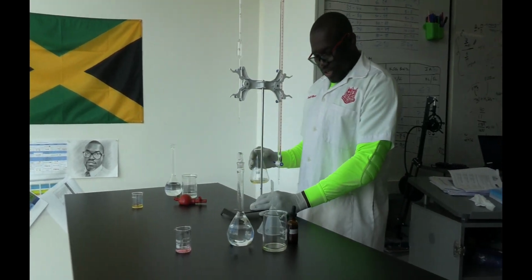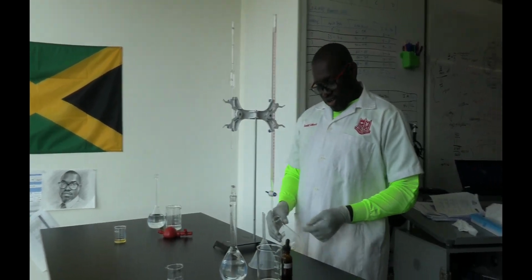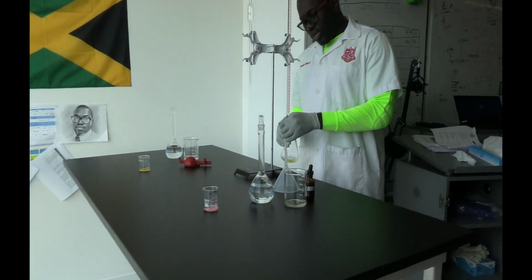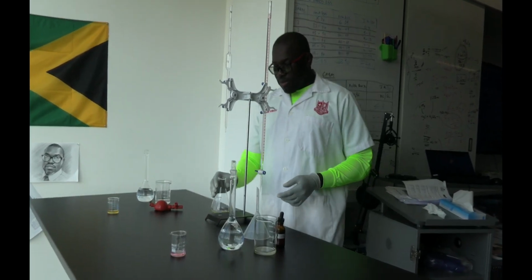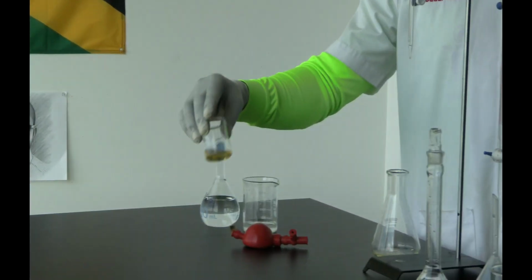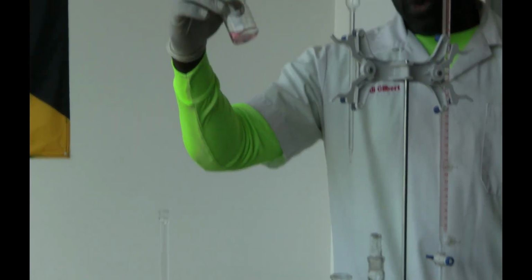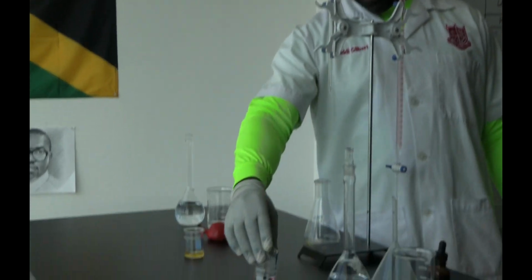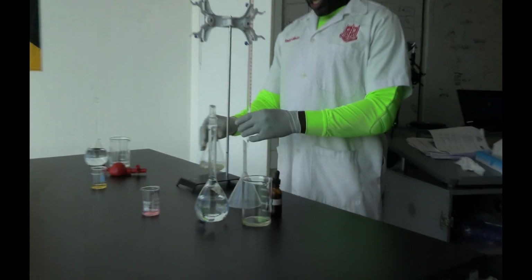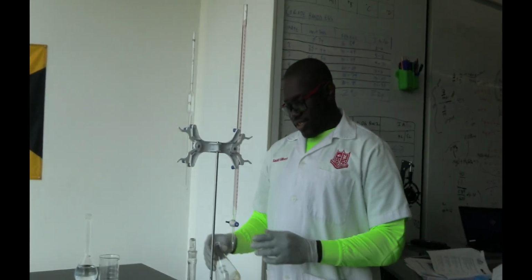And titrate means that I'll be adding a solution from a burette to a solution in a conical flask until I get to an endpoint in this context. And an endpoint is when I get a color change. And remember, we already showed you what the colors should look like. So here's the color of the methyl orange in base, and this is what it should look like in acid. So when I get to an acid, this is what my color should look like. So we now start titrating, and you must titrate with 2 hands, not 1 hand. You titrate with 2 hands.